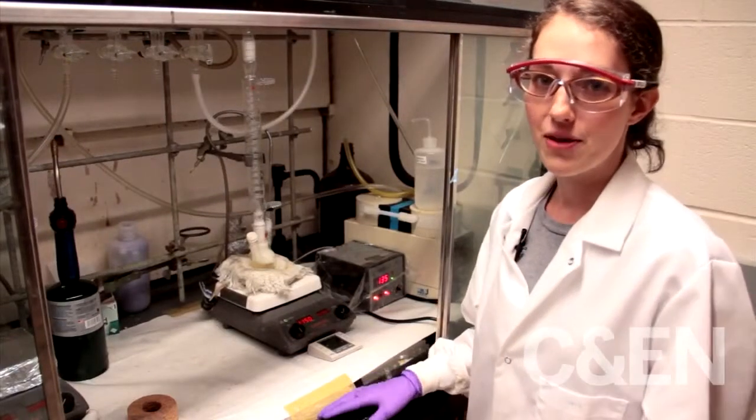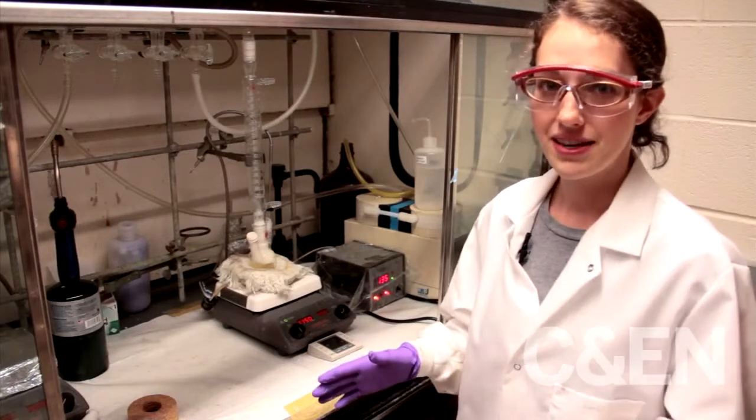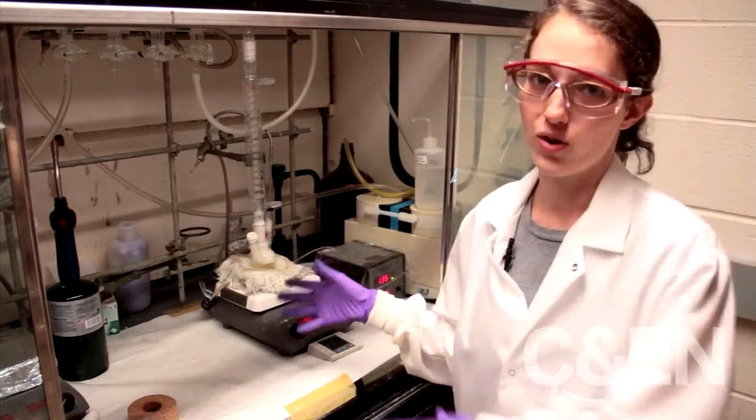So in our group, we make and use quantum dots, which are cadmium selenide nanoparticles. Today I'm going to start out by showing you how we make them.